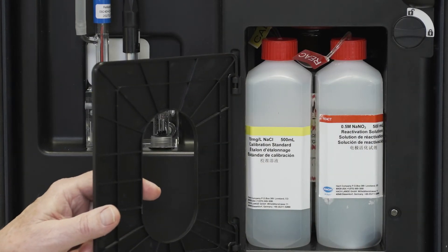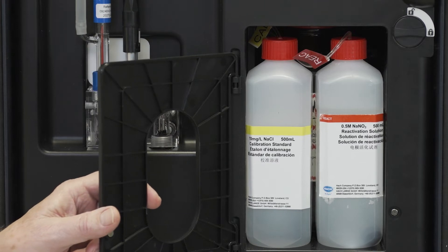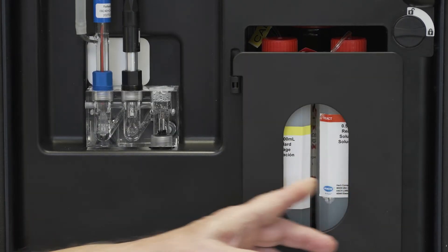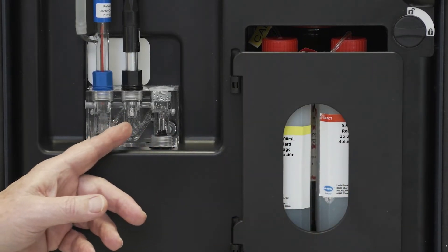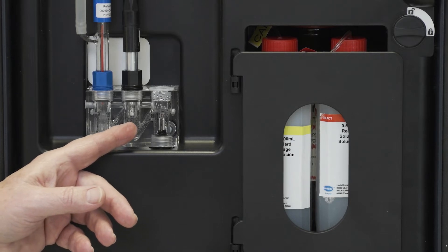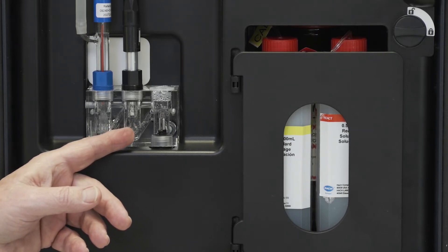We provide a reactivation solution that is a high level of sodium that will automatically reactivate the electrode according to when you set the timing for that reactivation.